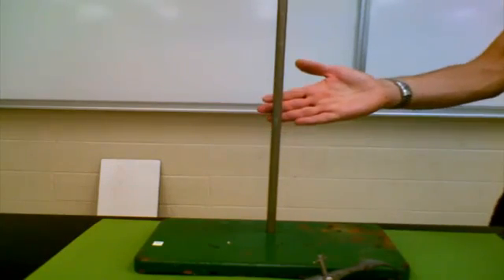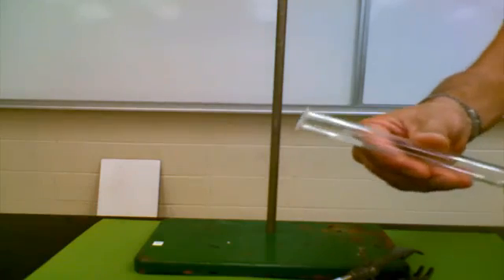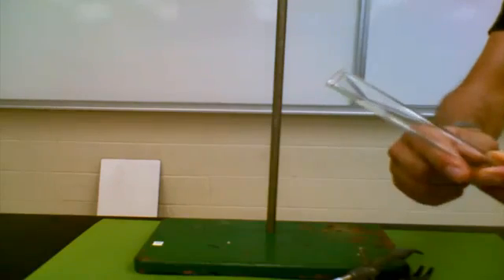In order to place a test tube correctly on a retort stand, you need three things. You need your retort stand, you need your clamp, and you need a test tube. It's very important that your test tube has a lip at the top. If it doesn't have a lip, go get another test tube.